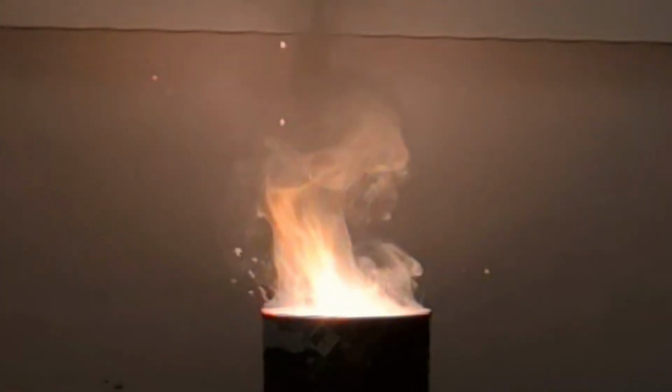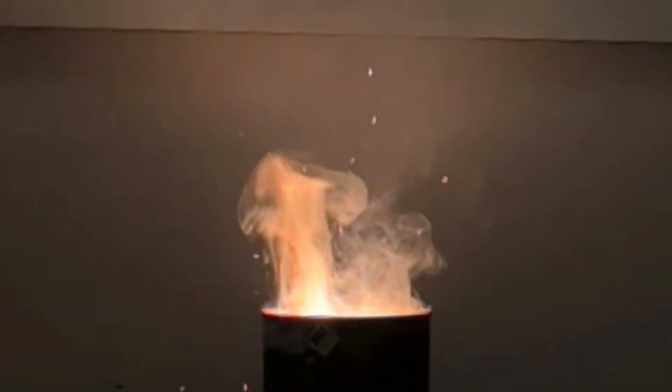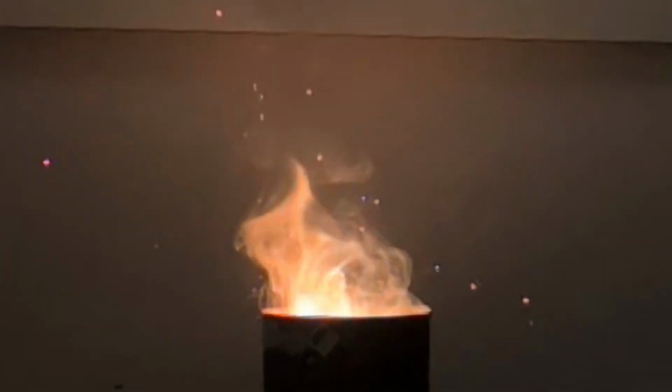The sparks you see are from the molten aluminum and iron being flung out of the bucket by the reaction. Sometimes, if the reaction gets hot enough, it will actually boil the aluminum and the iron inside of the container. I don't know if the reaction we had today was that hot, but if you want to see something like that, Veritasium has a few videos on thermite you can go see.